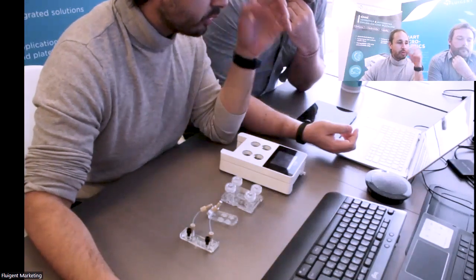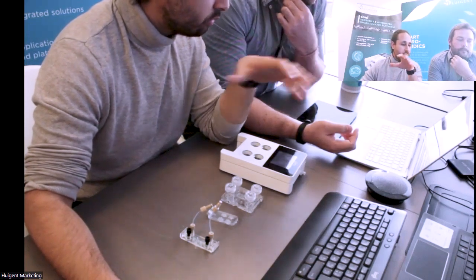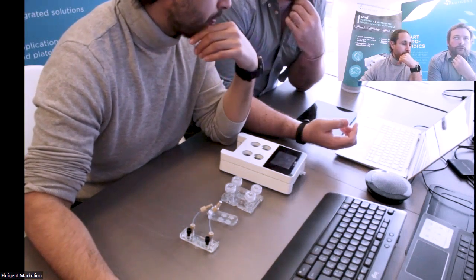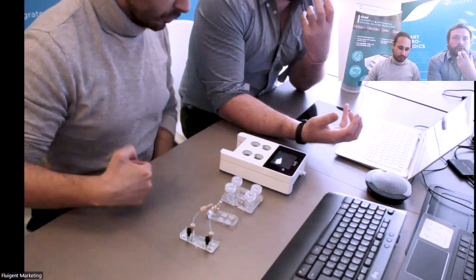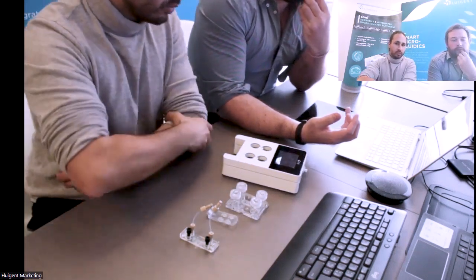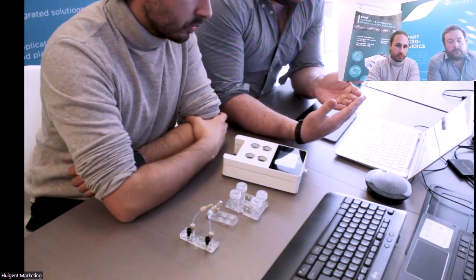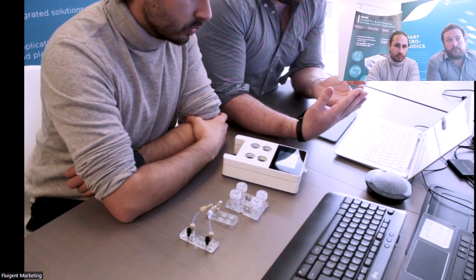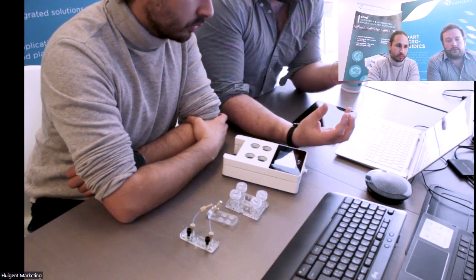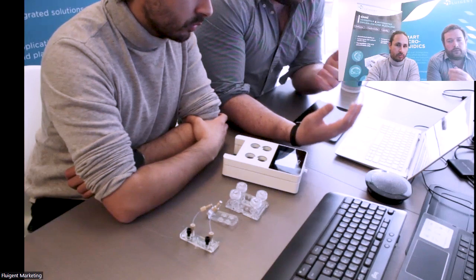So if you are part of the team, you can check the experiments of every OMI in the team. We thought the structure of the users in a way that allows sharing data. So this is what is called a team. Different accounts can be part of the same team, can use the same OMI, and you can define if you want to share data or not with the different users.